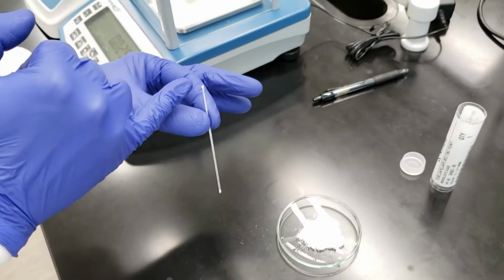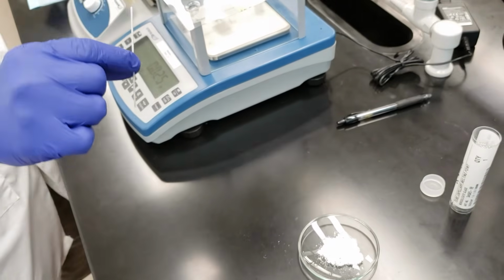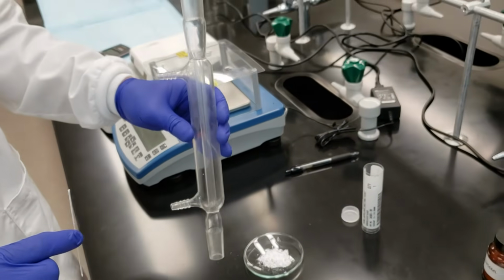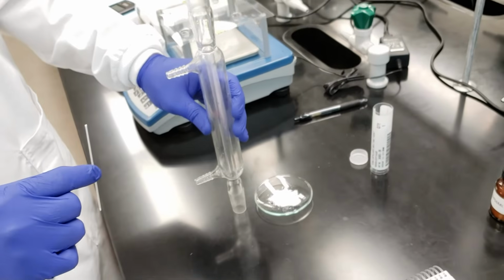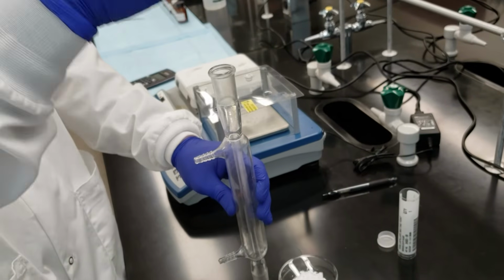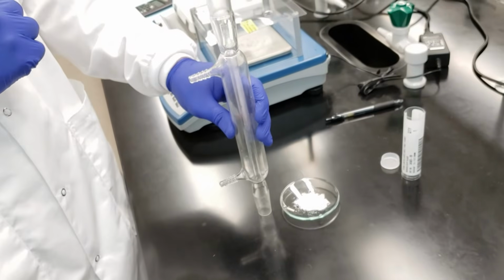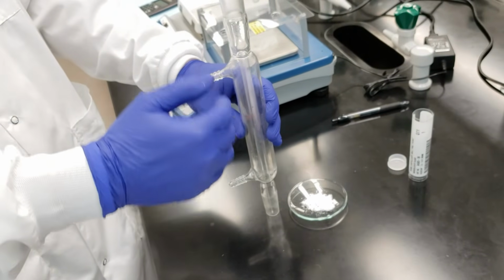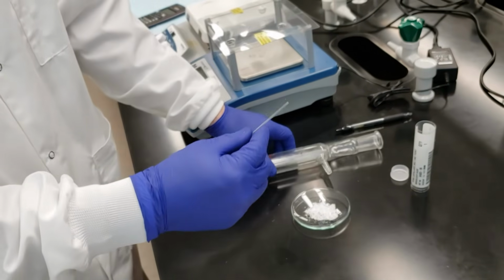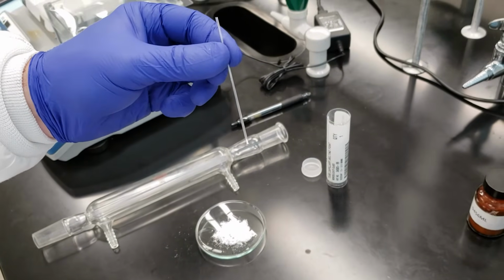Now another way that we can get these crystals into the bottom is to use our condenser. Here's our condenser from our lab drawer. What I'm going to do is set the tip on the bench top, and I'm going to drop this through bottom side or closed end down, and it's going to tap and bounce and tap and bounce. And then when I take it out, you notice that all the crystals are now on the bottom. So that's another effective technique.